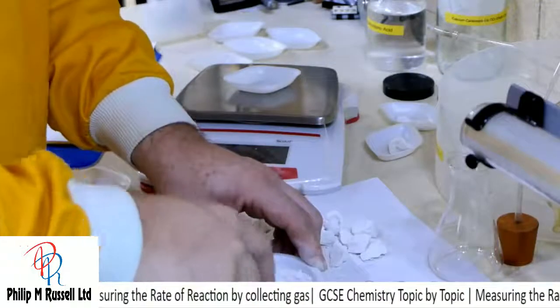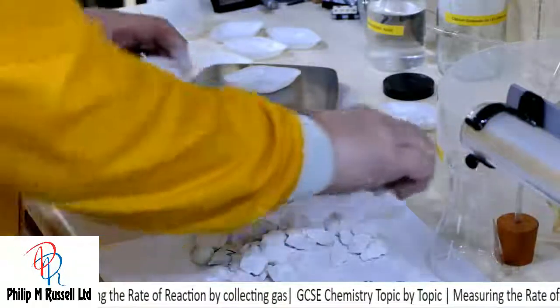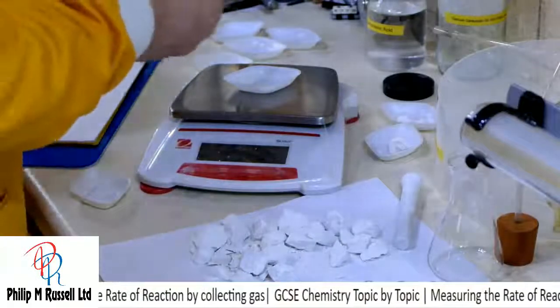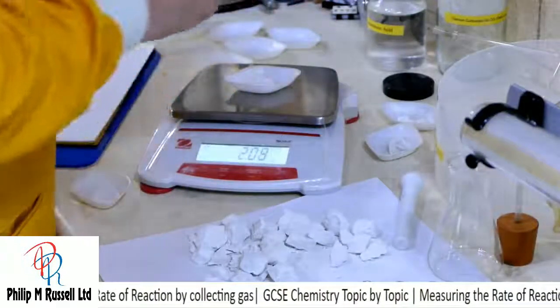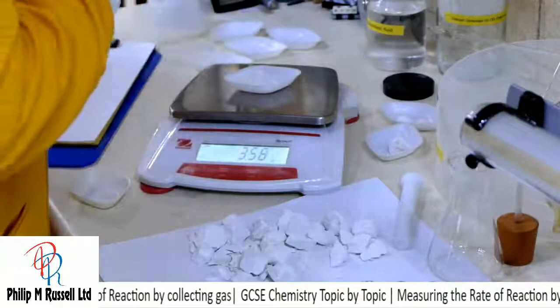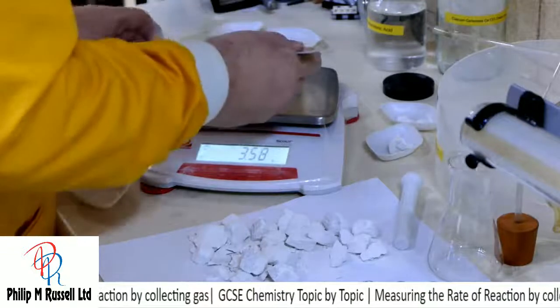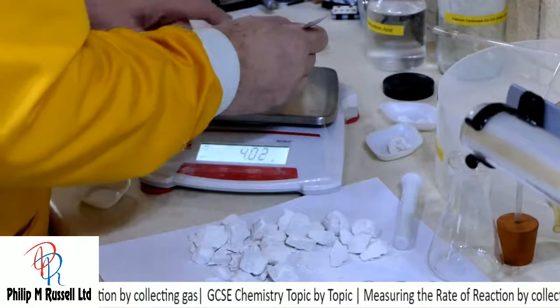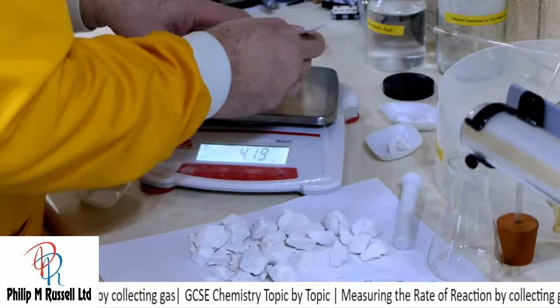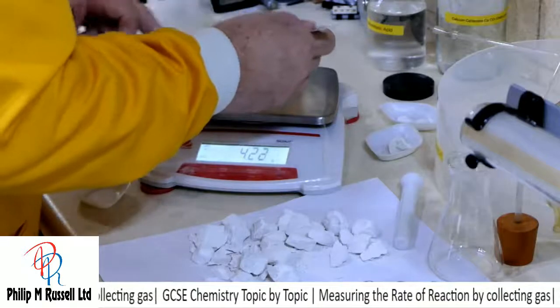So there we have some nice chalk powder. And I want 4.2 to 4.23, so we can go and I'm just tapping this, just trying to get out just a tiny amount.